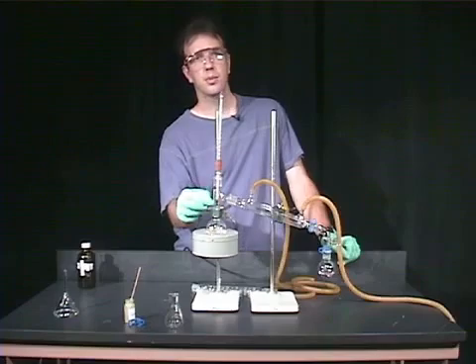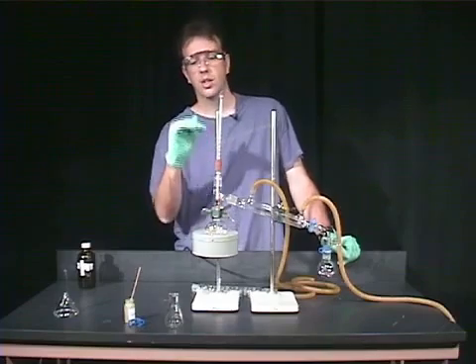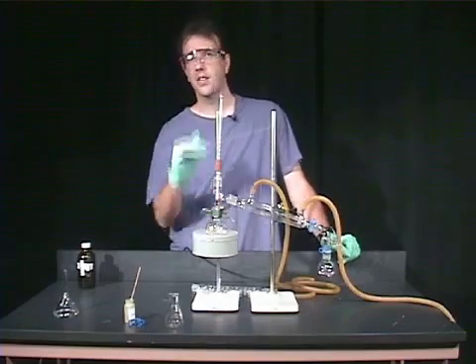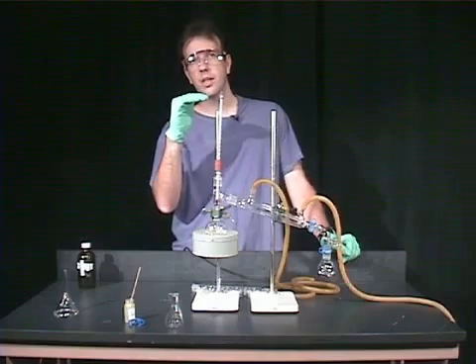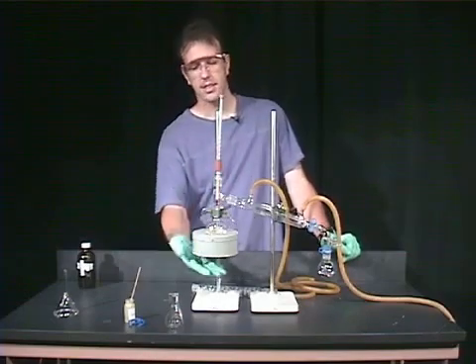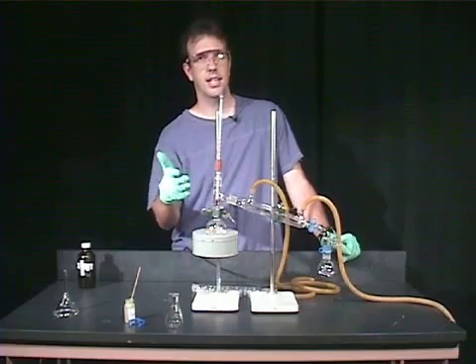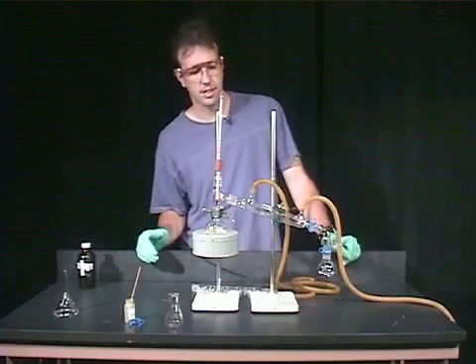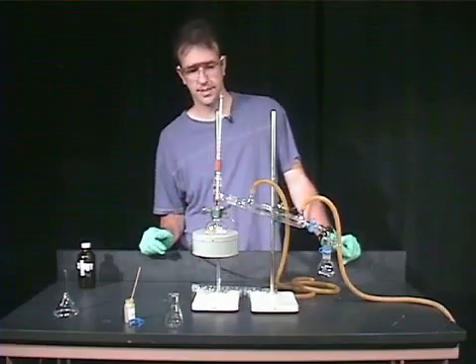Once it reaches the thermometer bulb, the temperature will rise very rapidly up to the boiling point of the solvent that's coming over. So in this case, that would be the boiling point of ethyl acetate because I'm simply doing this distillation with pure ethyl acetate.